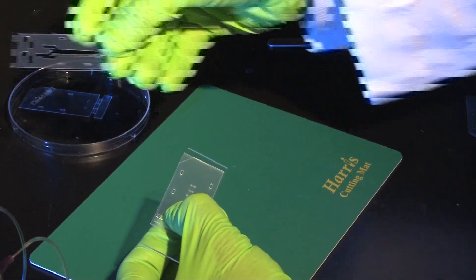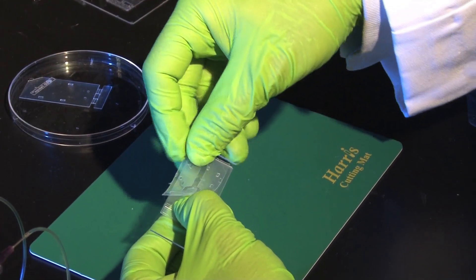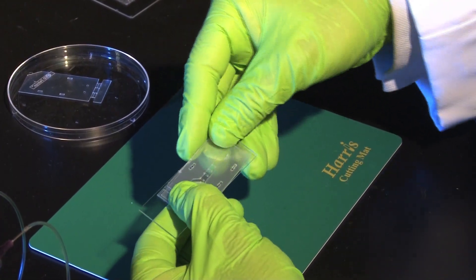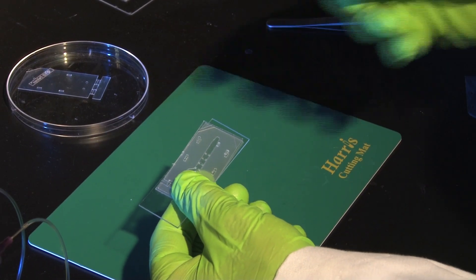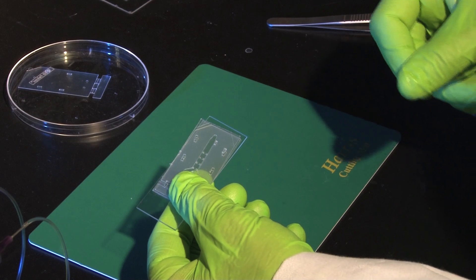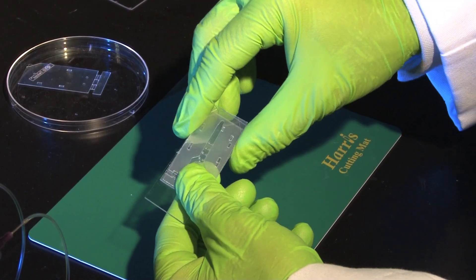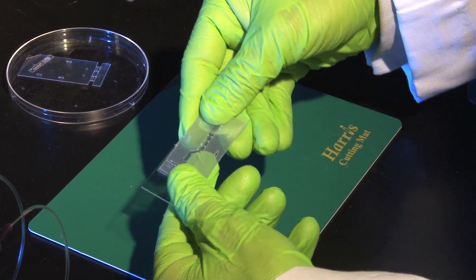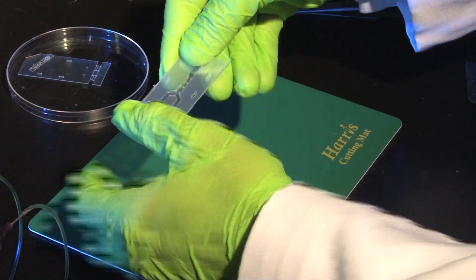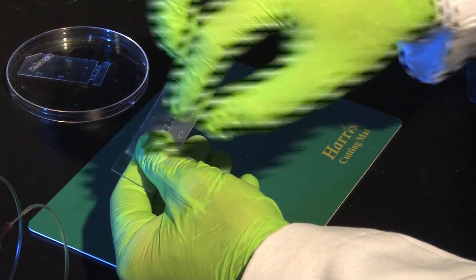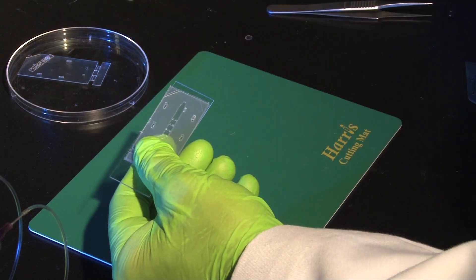And the last part that we put is another part of double-sided tape and actually the reason why we put this is so that it will facilitate afterwards when we use the upper part of the channel of the device. It will help it adhere because the other side has also got adhesive as well so that you can remove from here the liner, the other one as well, and then you can close it.